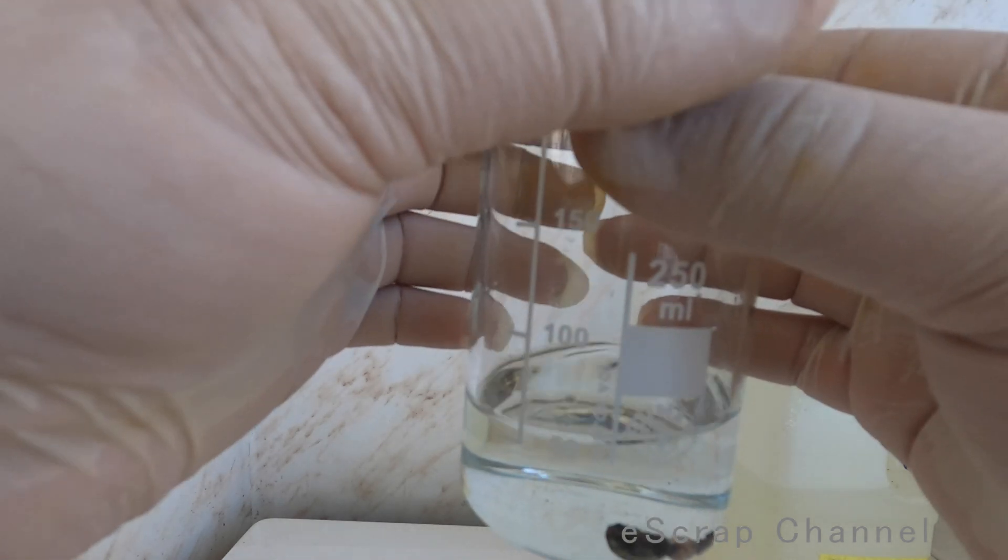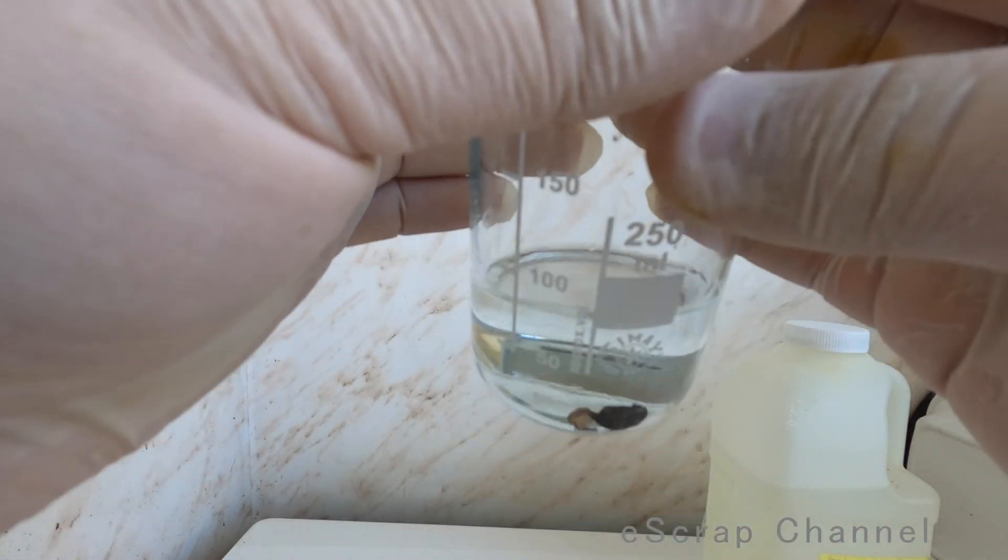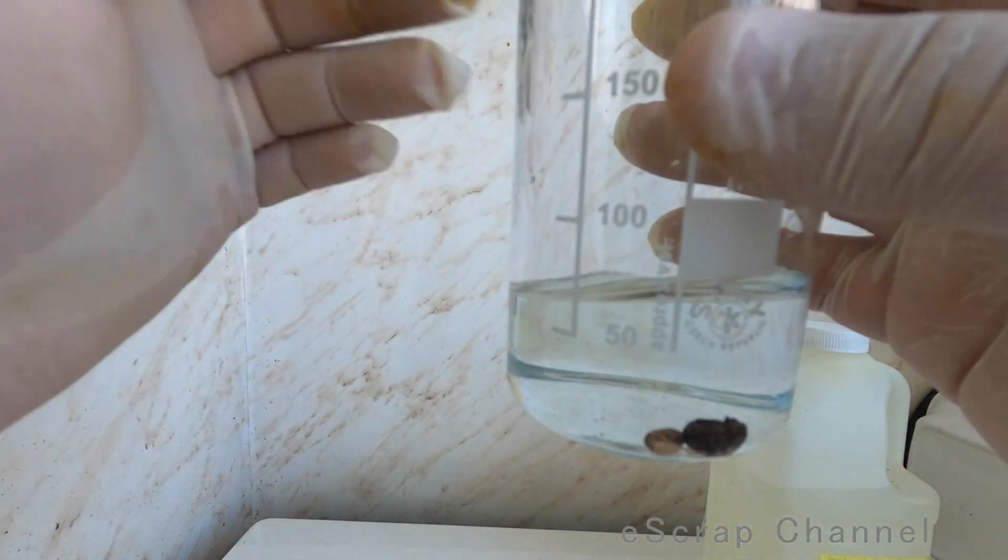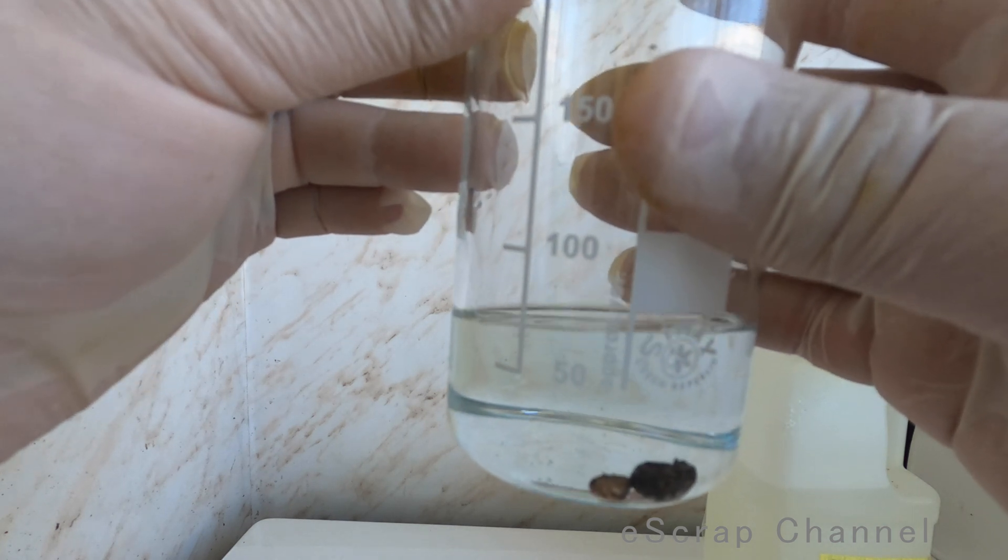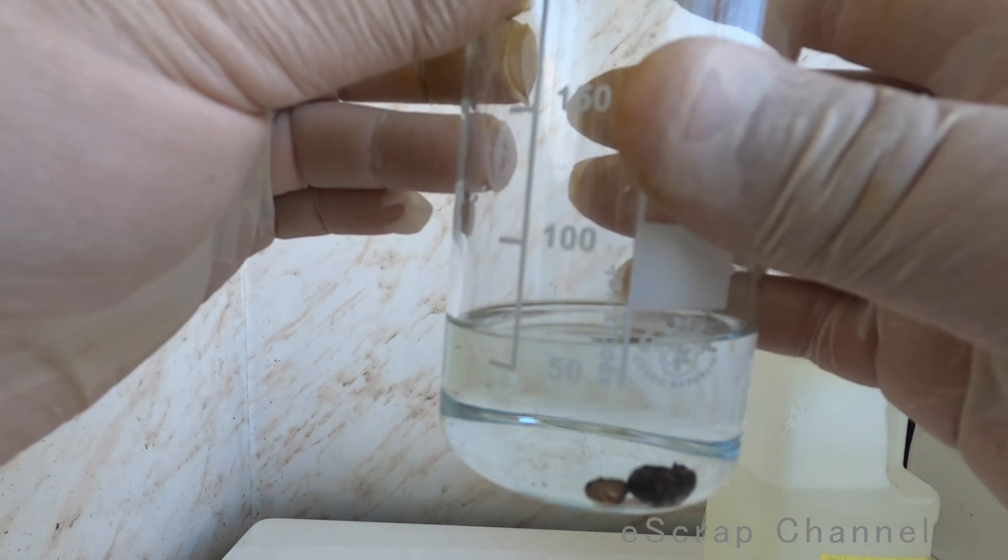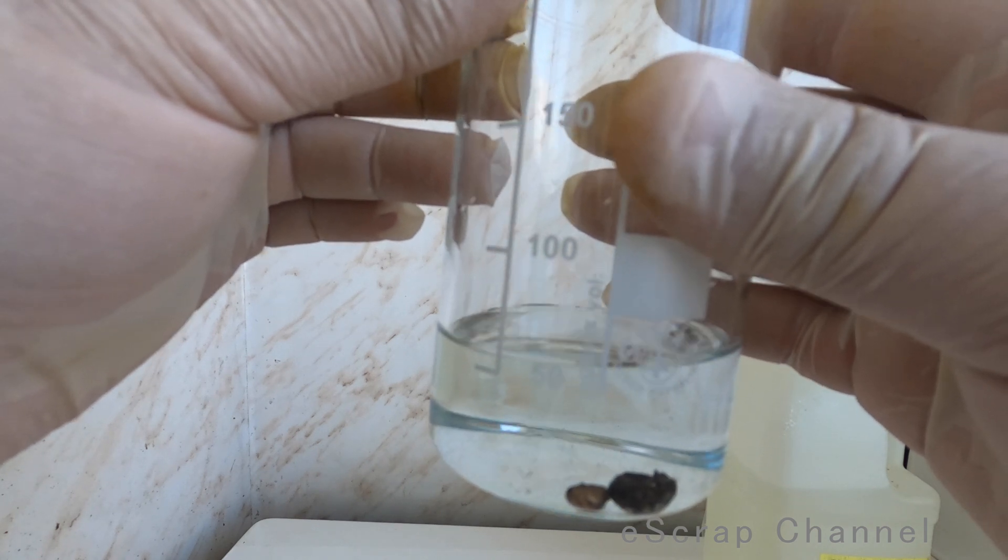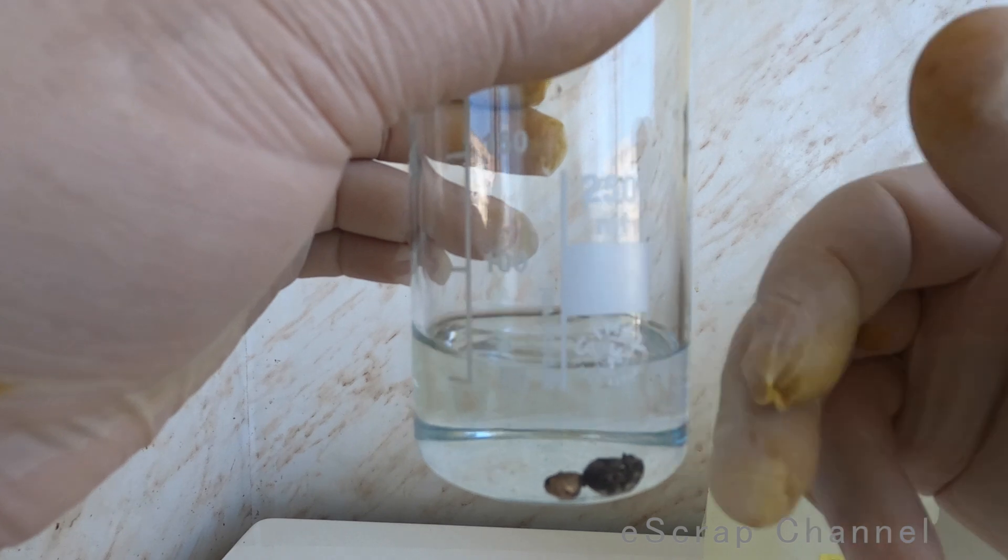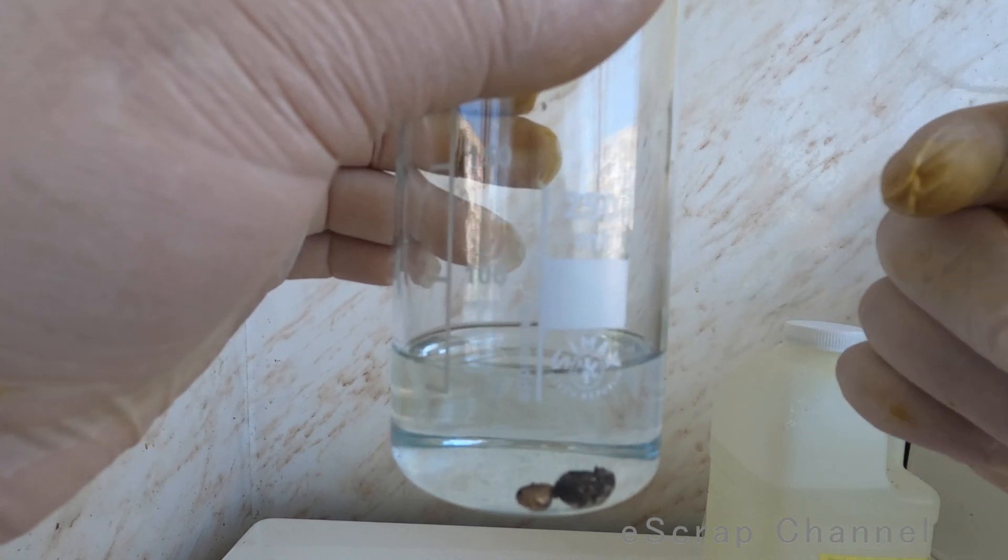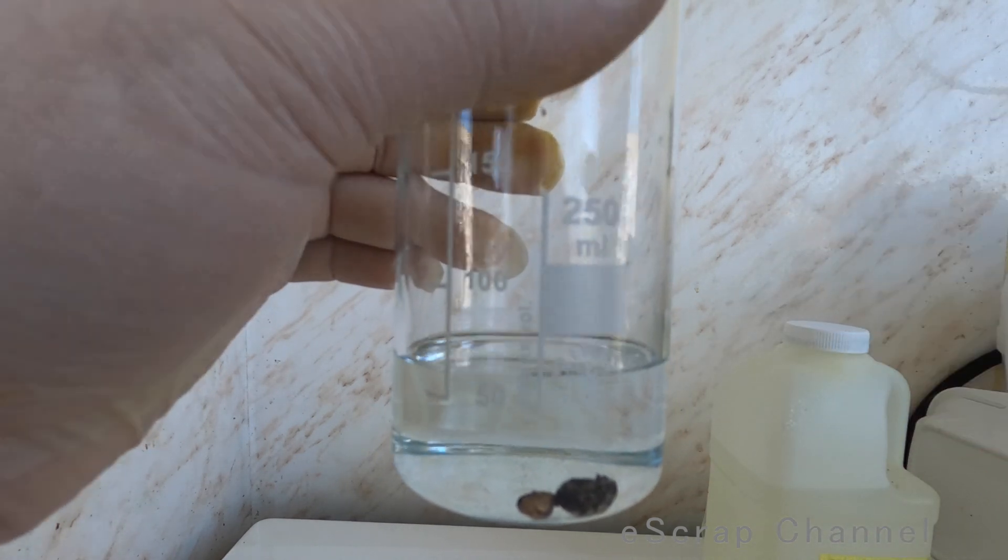So actually in this diluted nitric acid, that's what we expect base metal to dissolve if we have copper or anything else. Let's see how we'll proceed after that. I'll leave this for maybe 10 minutes or maybe I'll even heat it a little bit.